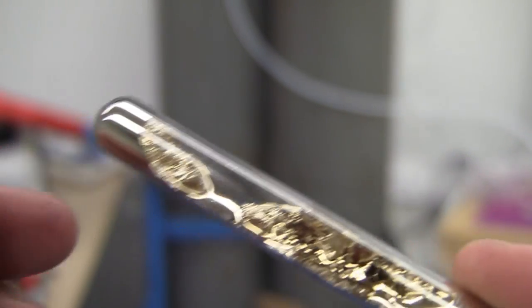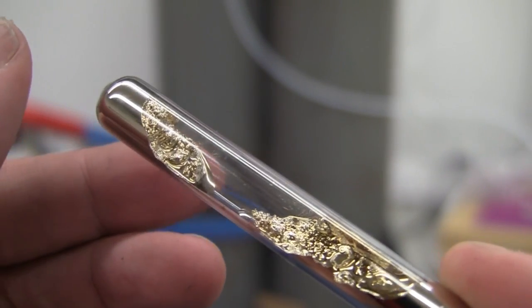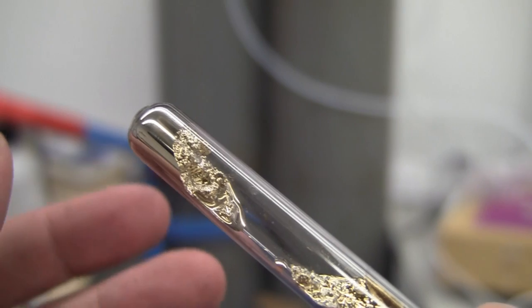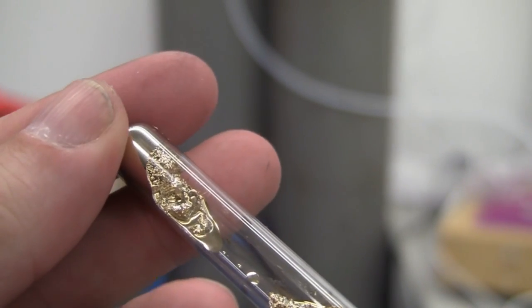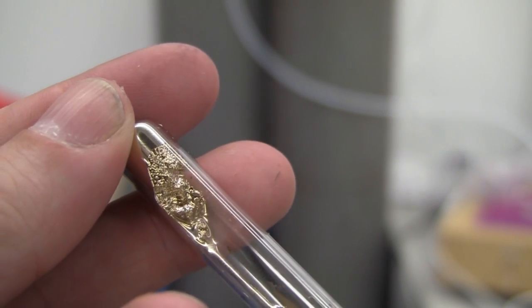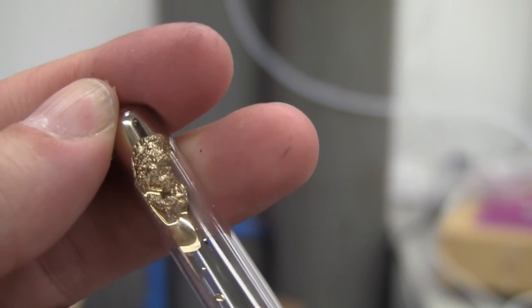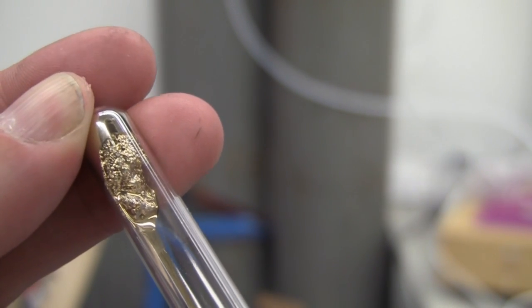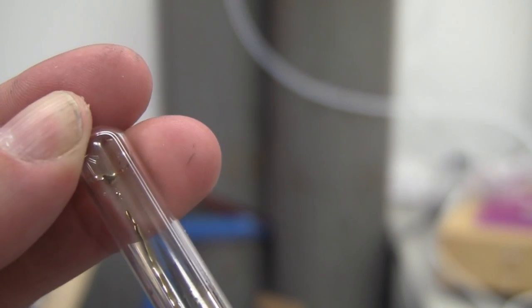Here I've got it partially melted. I'm just going to melt the rest of that. That's melting anyway. I'm just going to melt it with my fingers, just like that, melting the cesium with my fingers. Boom.